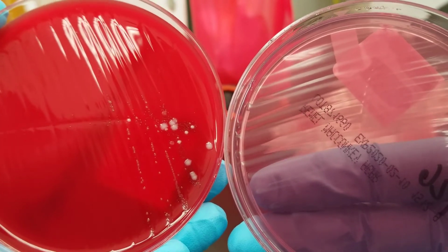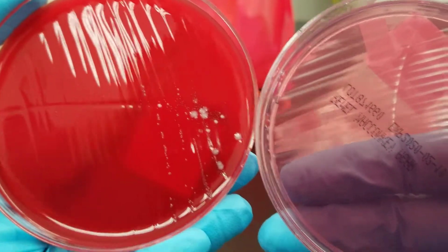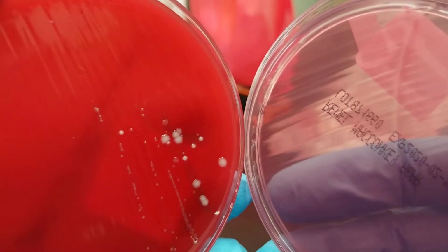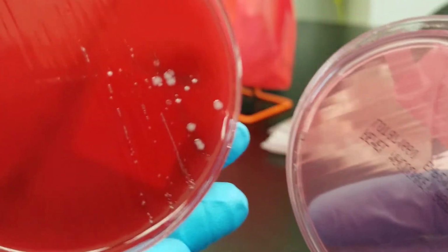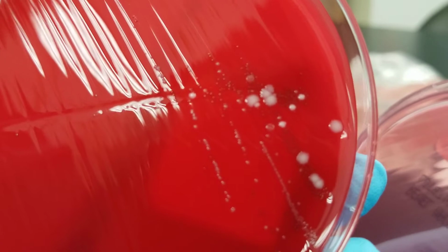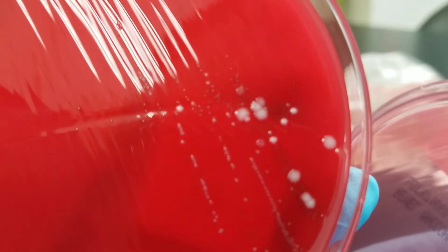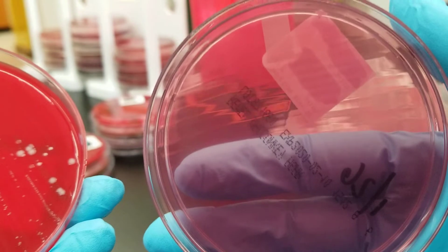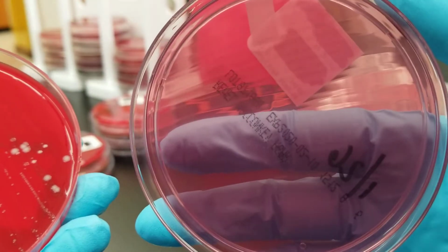So without the gram stain of any of these, honestly, we can't really say a whole lot. But looking at this, we have, let's see, like 2 different organisms, okay? And they pretty much look like normal flora. Nothing's taking over the plate like it's a pathogen, and we have nothing growing on the MacConkey agar plate.